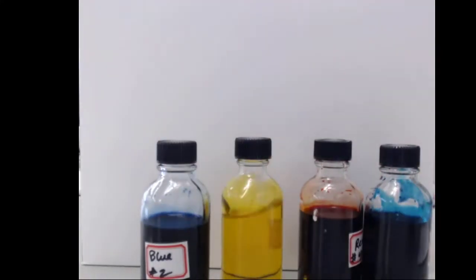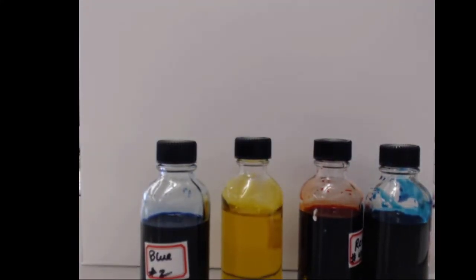So we've got 4 dyes we're going to consider, and in a lot of ways this is similar to what we did with the absorption lab, in that we're looking at dyes, we're looking at the components that make up the dyes. We're going to have some separation occur, but this is going to be experimenting with a different property of the chemical compounds. Rather than looking at the energetic interactions with light, we're going to be looking at the molecular properties of whether it has a dipole moment or not.